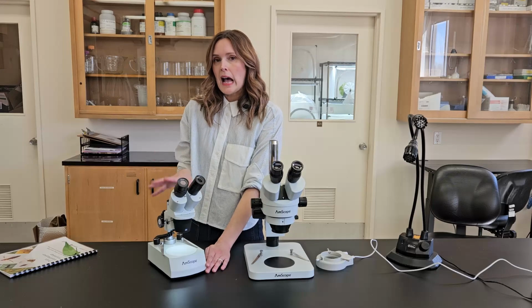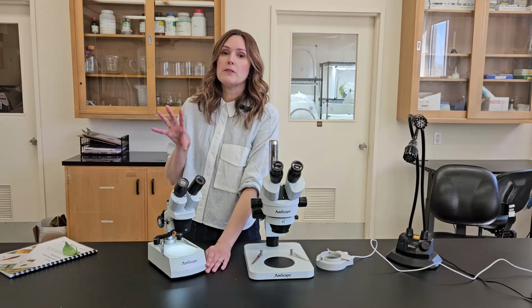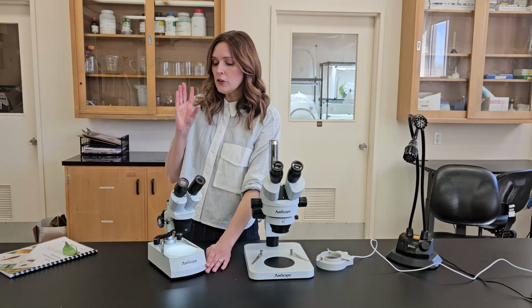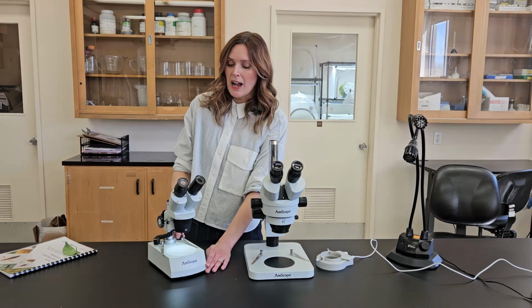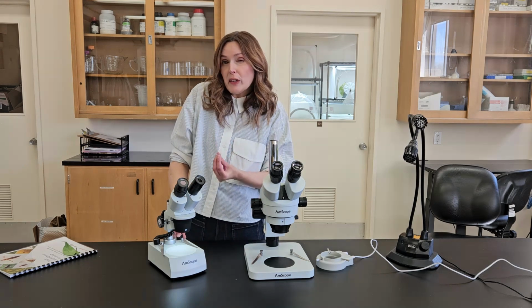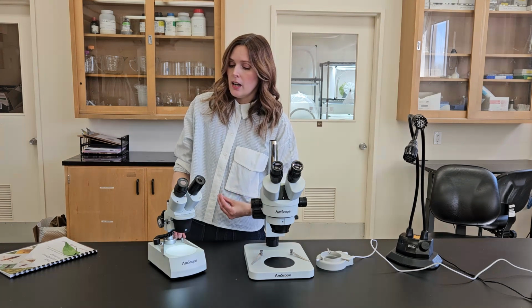So this might be advantageous to you if you're planning on bringing it to different greenhouses. Say if you're a bio company rep or consultant, there may be a benefit to you not having to have it plugged in all the time. I would say this light is adequate, but it's not super bright. I like a really bright field of view, but maybe that's just me because I'm kind of blind.